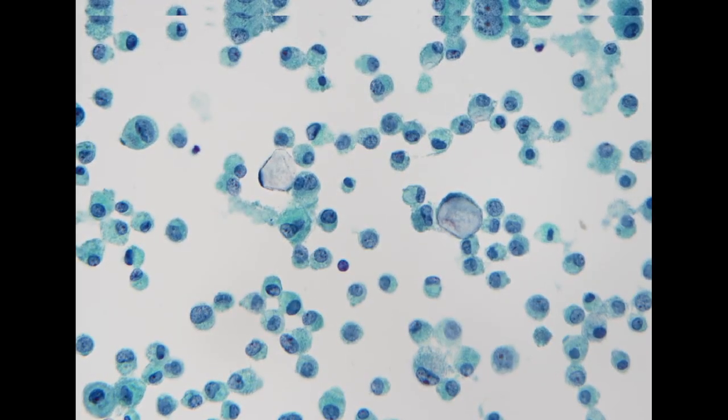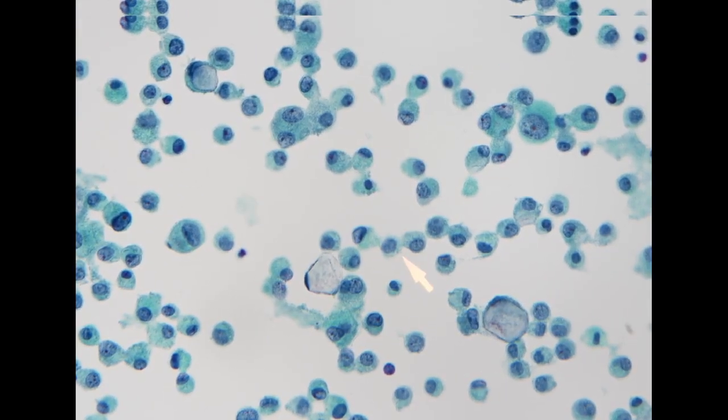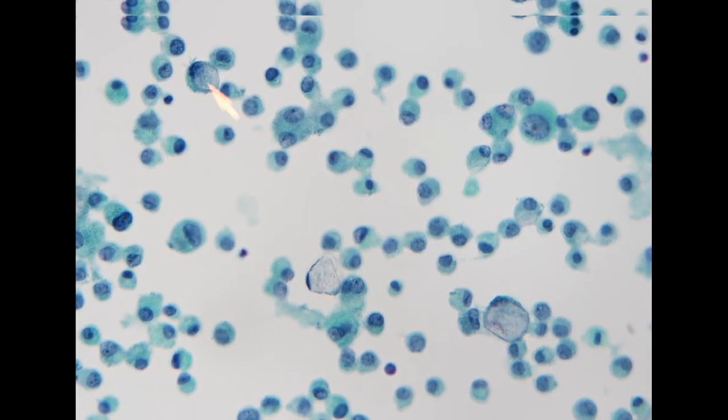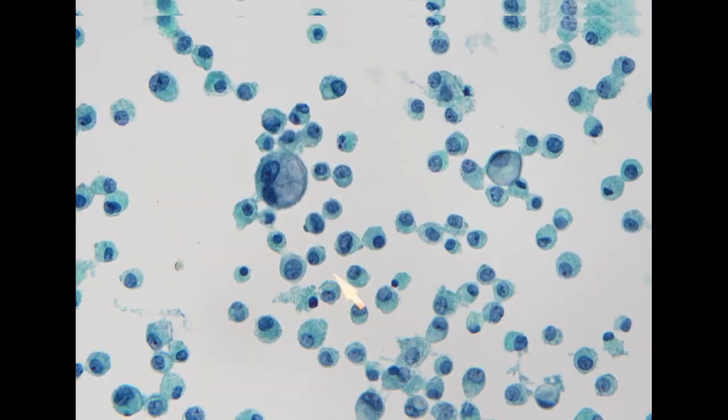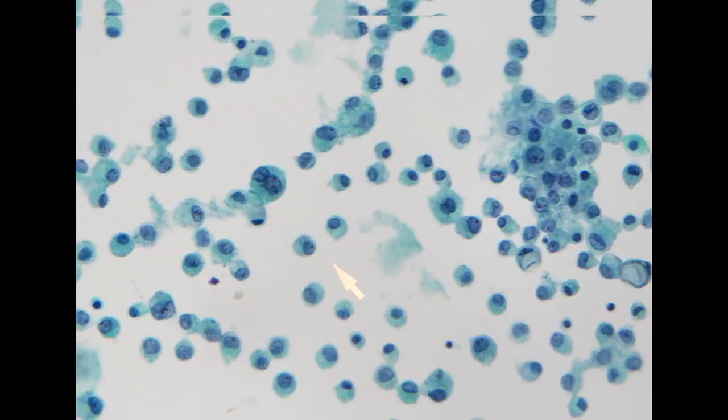Lobular carcinoma is one of the challenges in cytology, especially in fluid cytology. And we see that occasionally lobular carcinoma does show signet ring cell feature in effusion cytology as well. So I think this is a good case that we can try to report in our annual meeting because the first specimen is actually from the ascites. And the patient received a biopsy yesterday, so we will see the result of the breast biopsy, but it should be a lobular carcinoma.